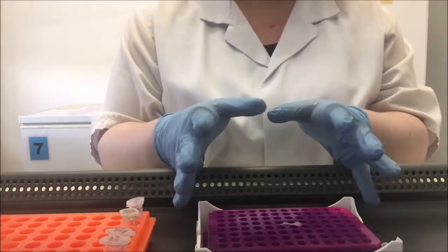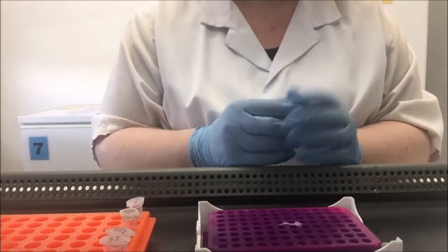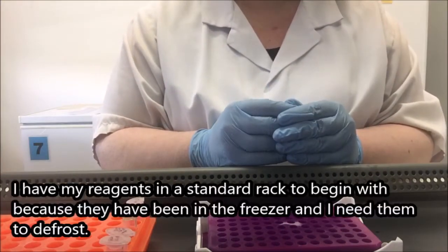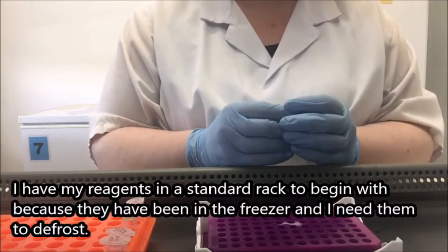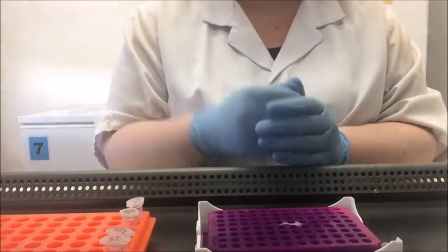This will allow me to keep my tubes cold while I'm working. And the rack you can see just here is the standard rack that we were using earlier with our DNA extractions. I've got a range of pipettes just off screen, as well as some tips. And I have some tubes and my rubbish disposal as well.